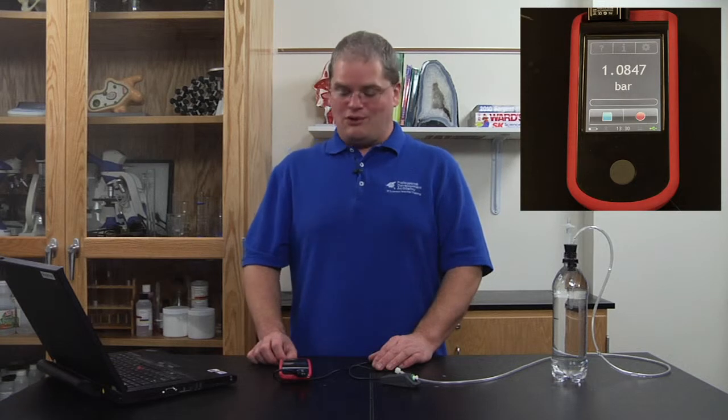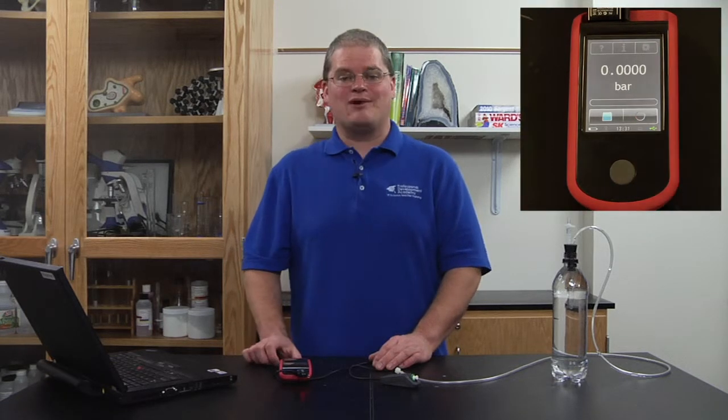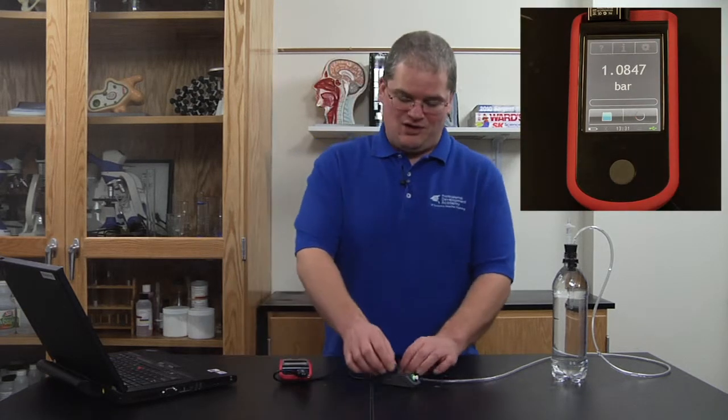Once I touch the red record button, I begin recording data. So I'll hook up my apparatus.